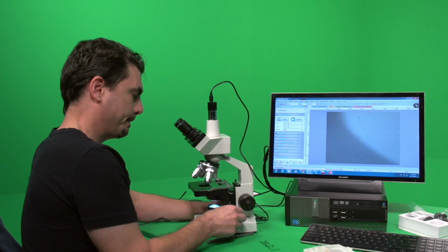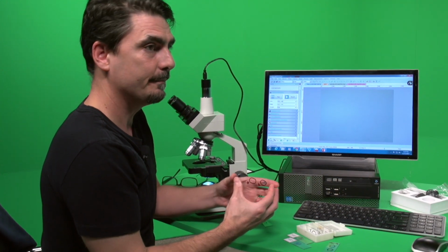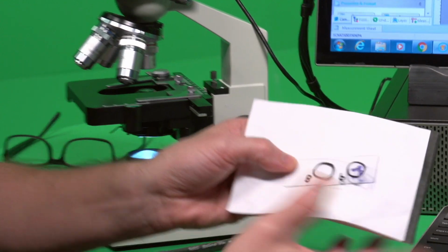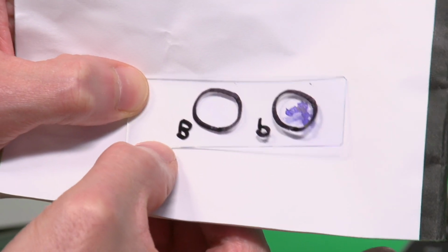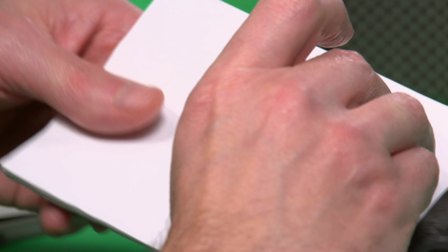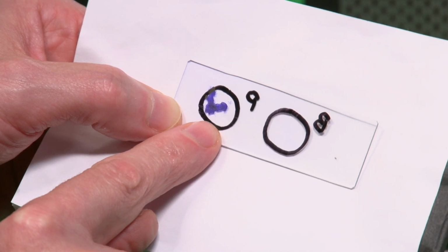So now let's look at a couple of the bacterial slides. First, actually, what I'll show you is on this particular slide, after staining, if we get in nice and close, look at the difference between them, right? This is P for plate and B for broth. It's actually like that, but we know that the bacteria are actually on the other side. And so remember, from the plate, we put a big smear from a colony. That's why we see so much bacterial cell.